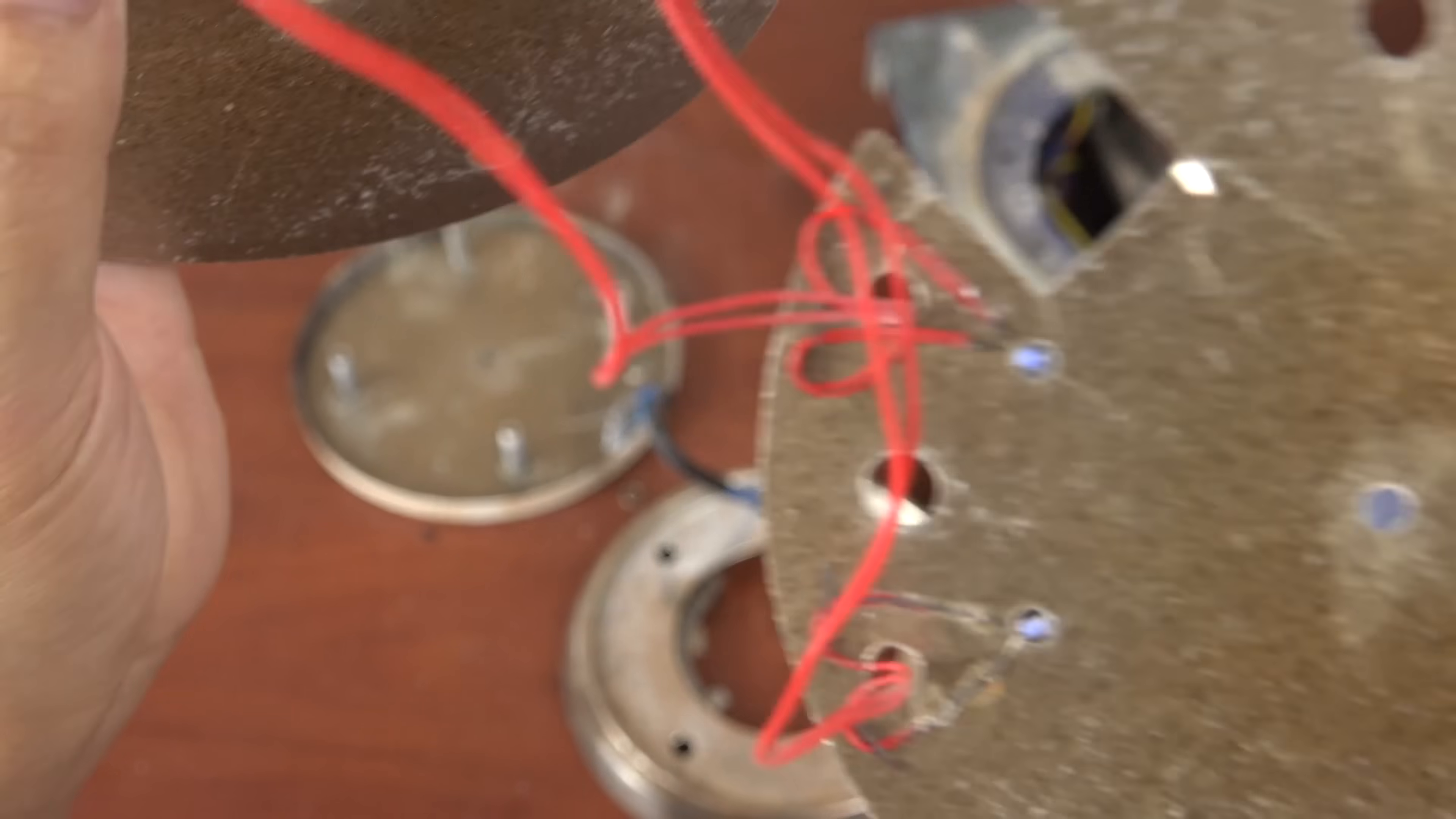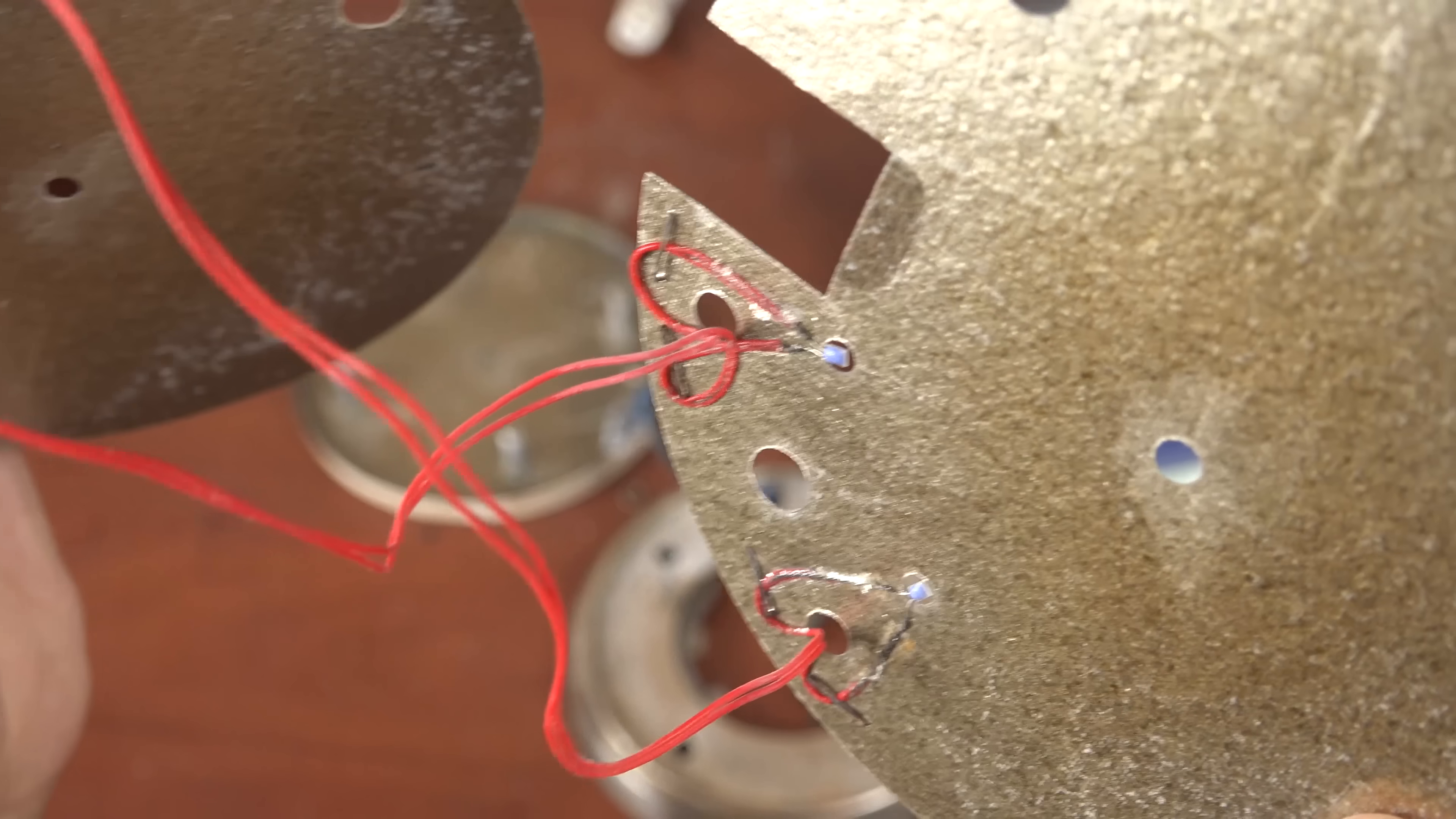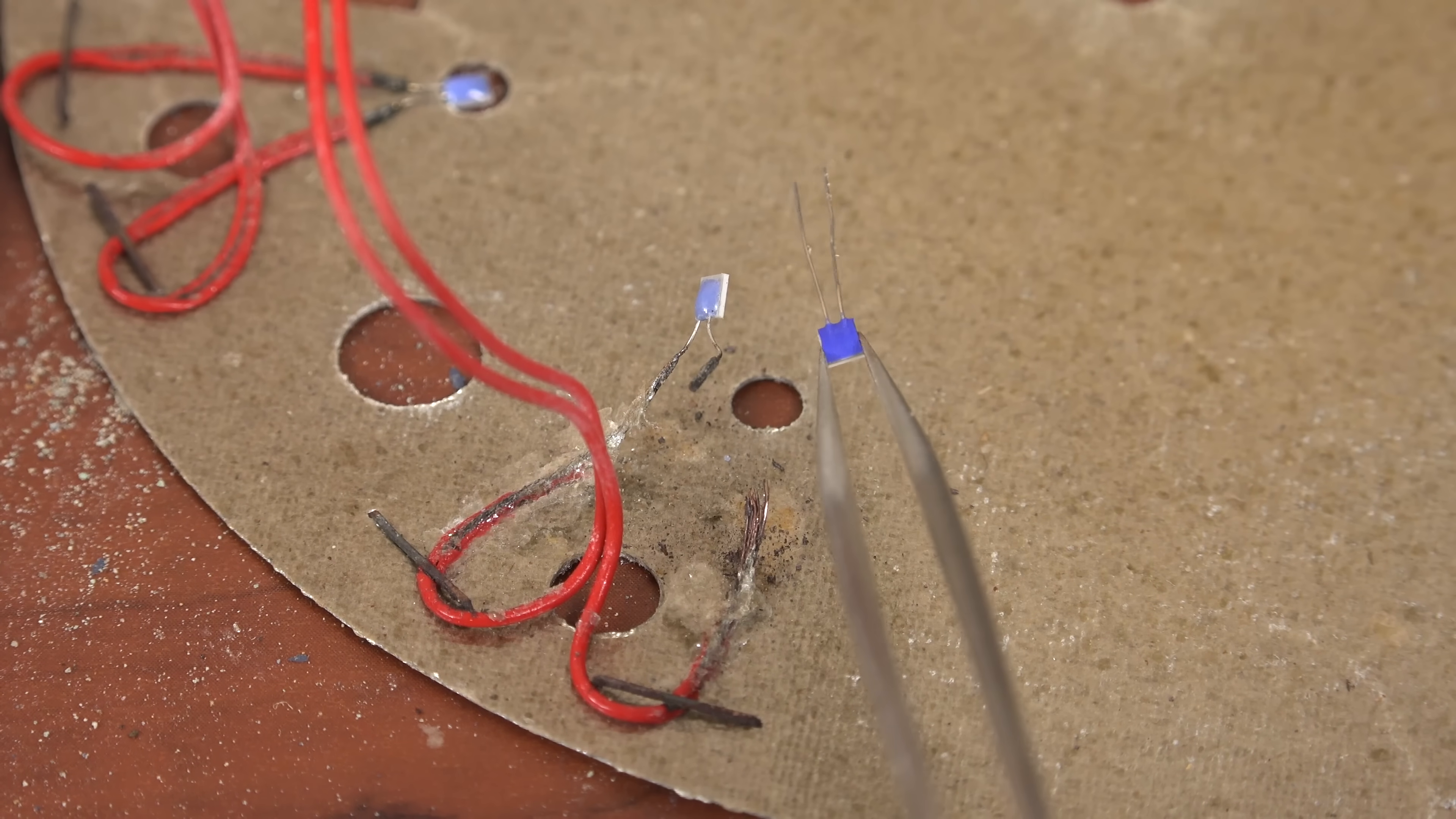And here are the sensors. It's very fortunate that this had two sensors so I could measure the working one and know which one to buy. If this didn't I would have to insert various dummy resistors until the hot plate gave a corresponding reading. Anyway, I'm now going to order the PT1000 sensor and they should get here in a week. Here I am a week later and I've already started bending out the broken sensor. Here is a replacement I've purchased and I'll see if I can get it in there.